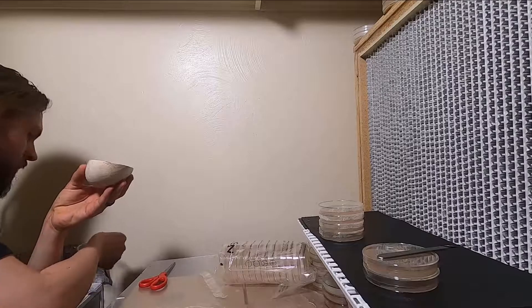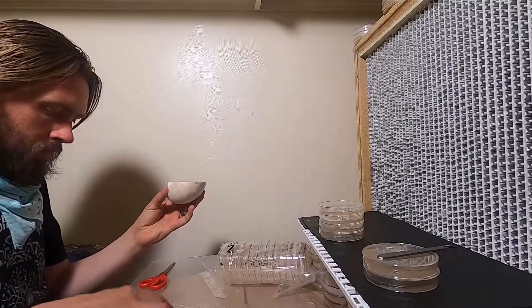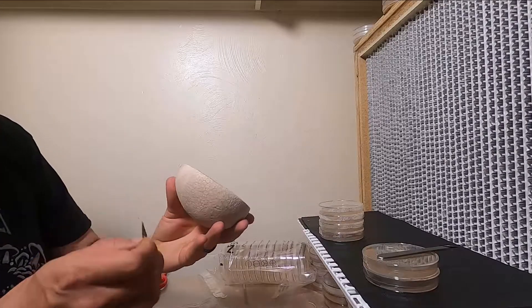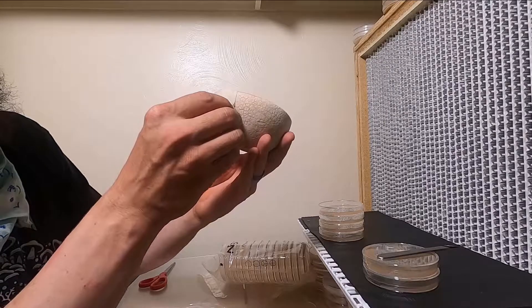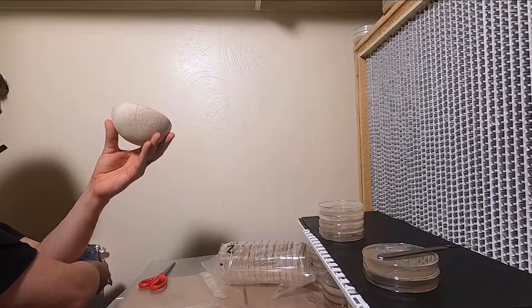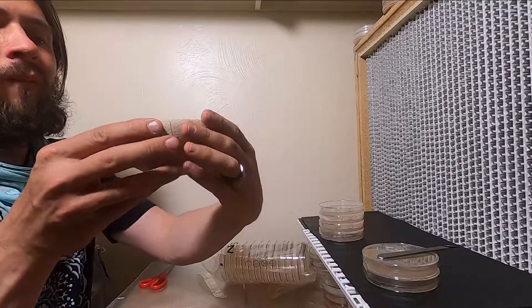All that center tissue will soon turn into the spore surface. So it will be full of spores, which is what causes it to be called a Puffball. I'm just going to take a dirty blade and start a little relief cut so I can tear it open and get some fresh, clean tissue on the inside.